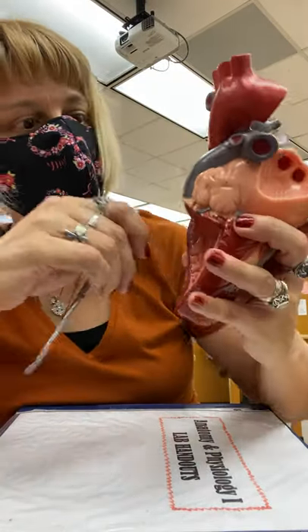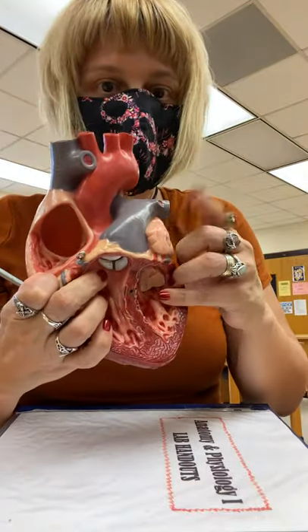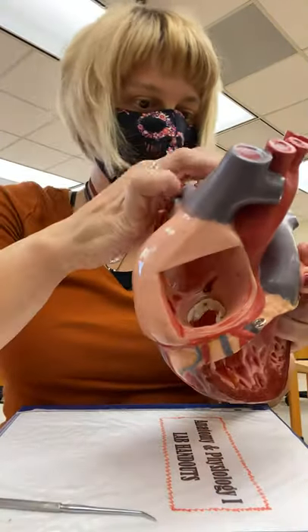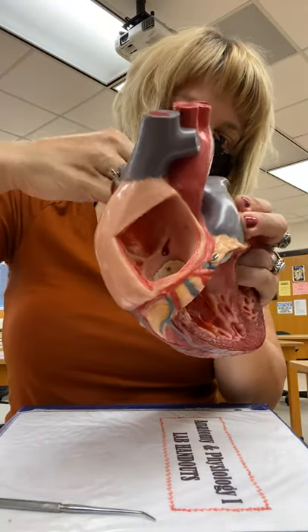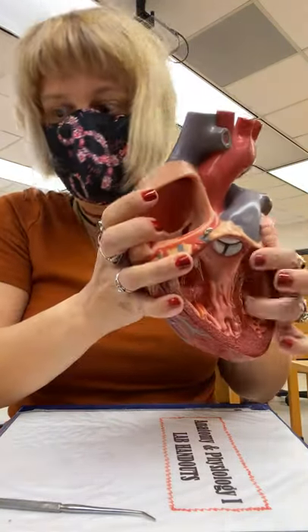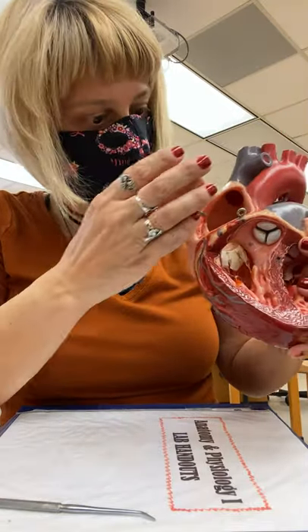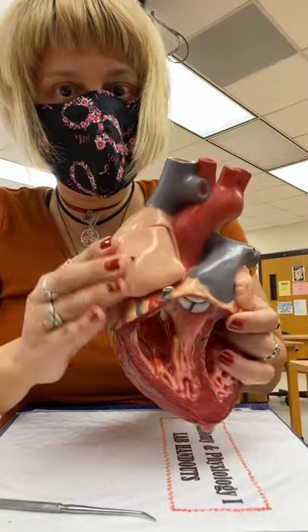We identified the left auricle and the pulmonary veins. We identified the right auricle as well, and I'm putting the lab model back together while reviewing.